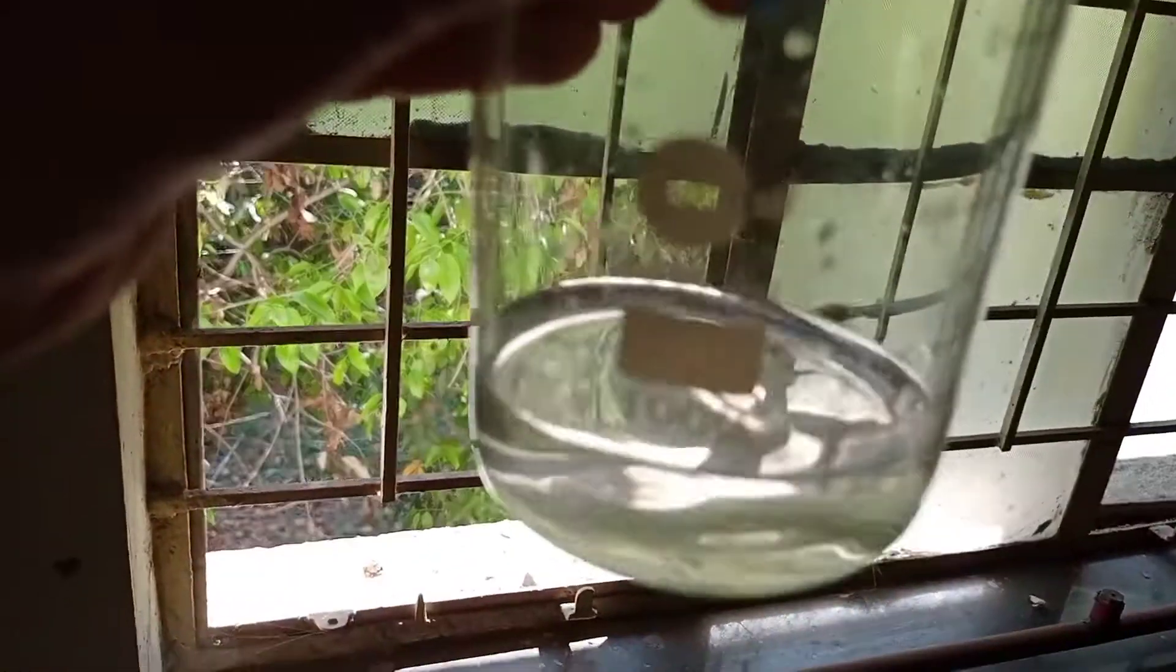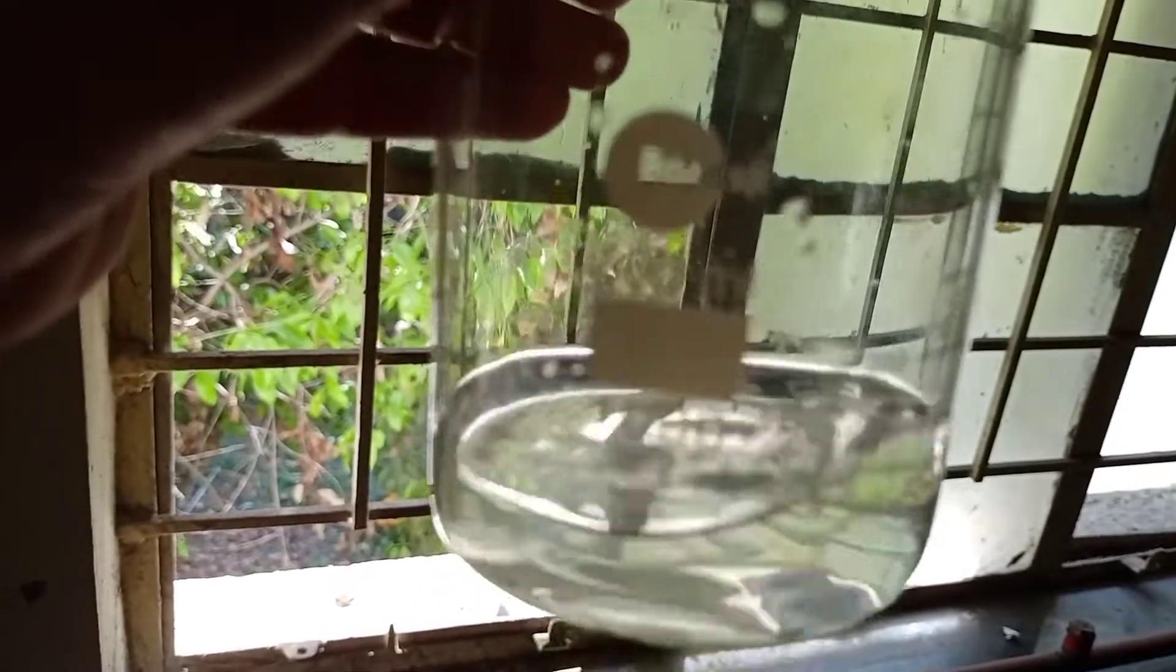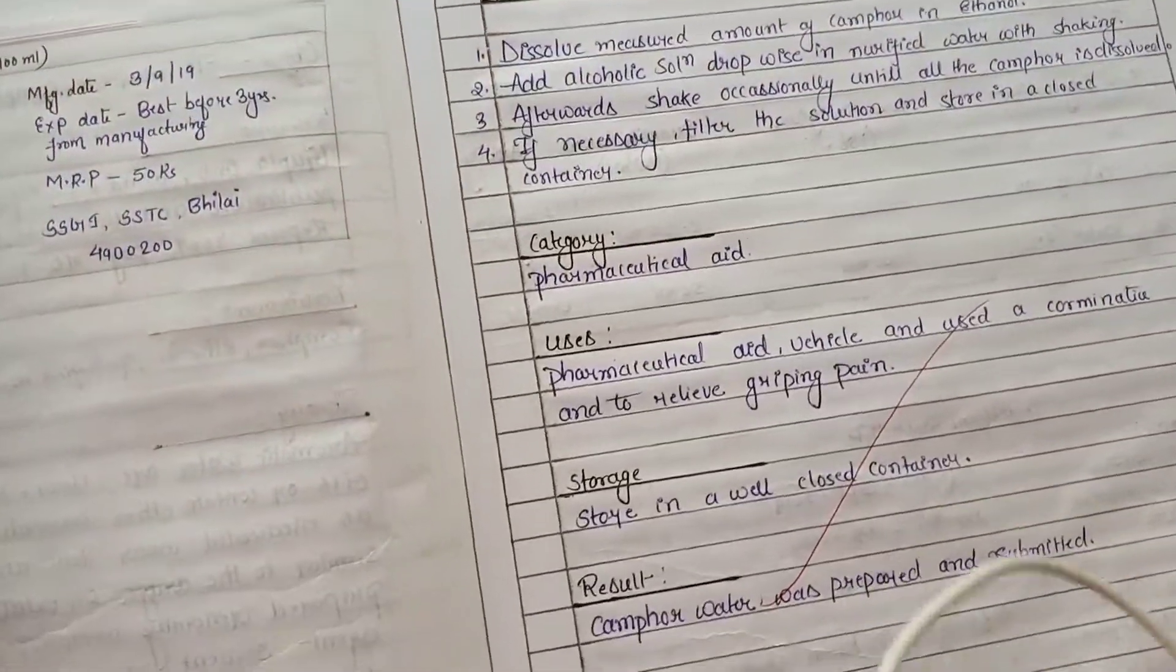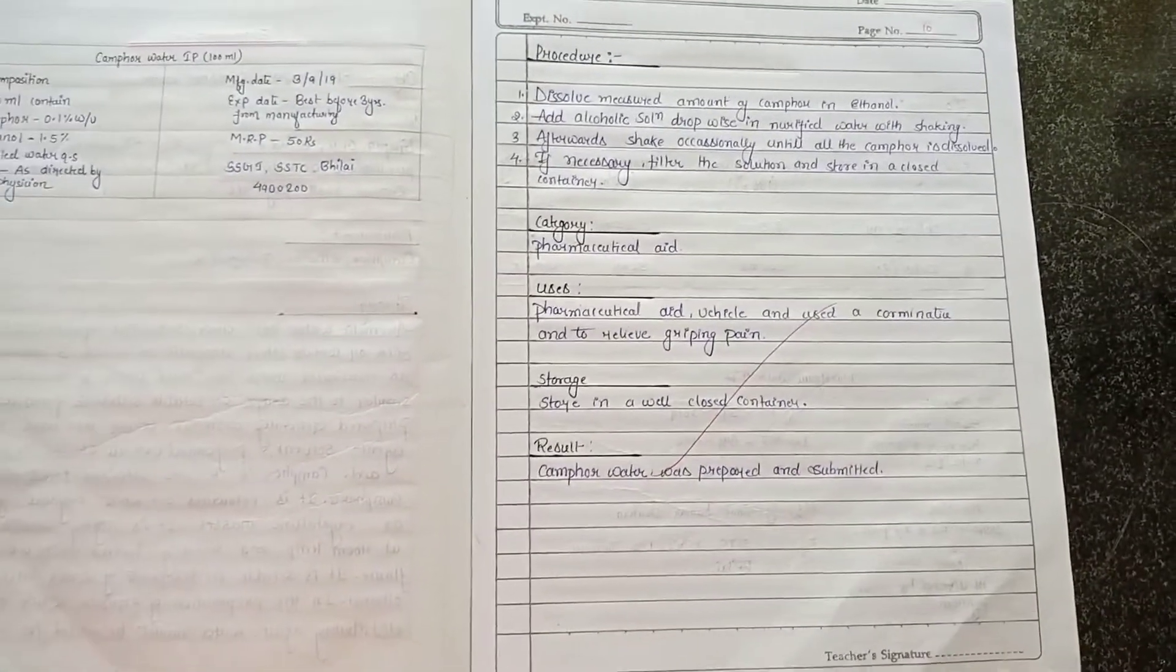You can check the water and ensure it is properly prepared and mixed well. Thank you.